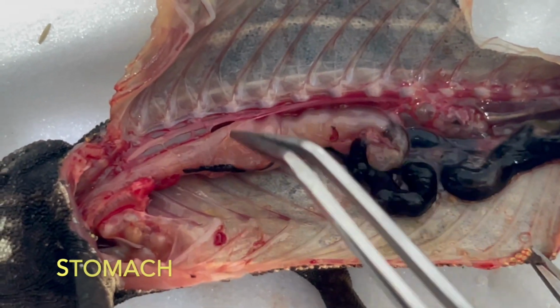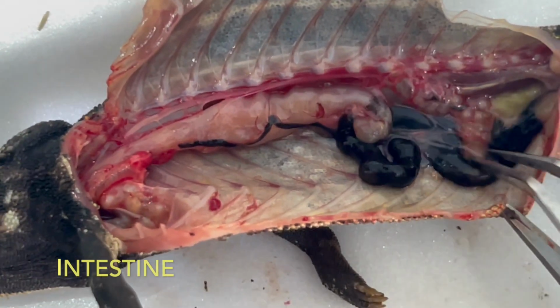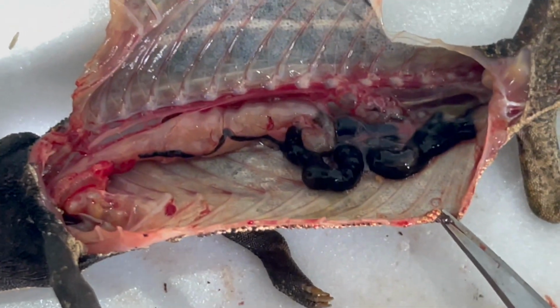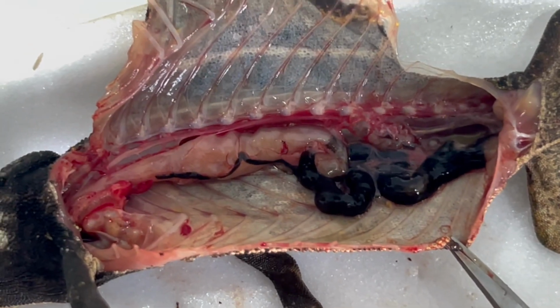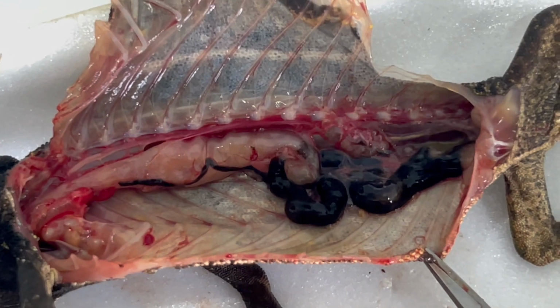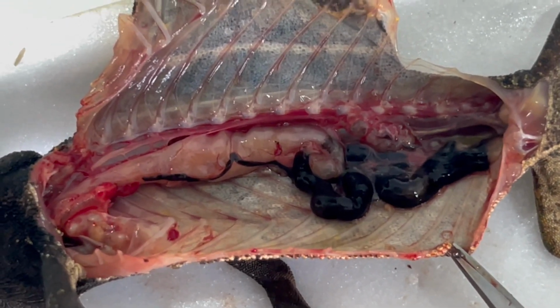This is then the stomach, and here the very short intestine. You can see why chameleons usually pass the food very quickly, and the intestine is really very short, even if compared to other reptiles.